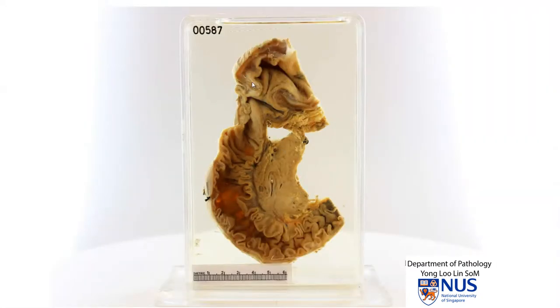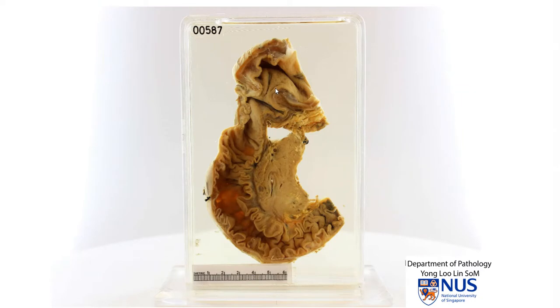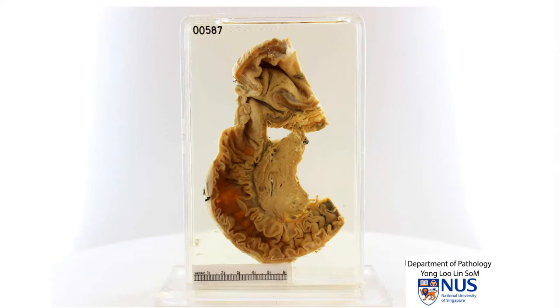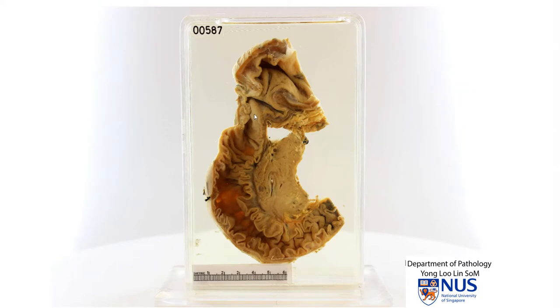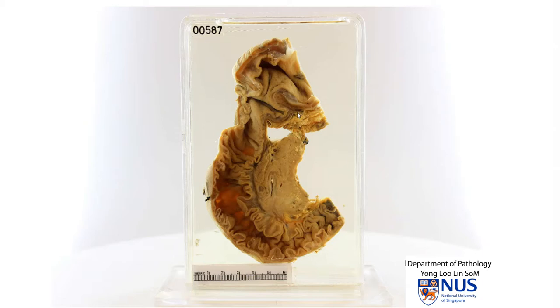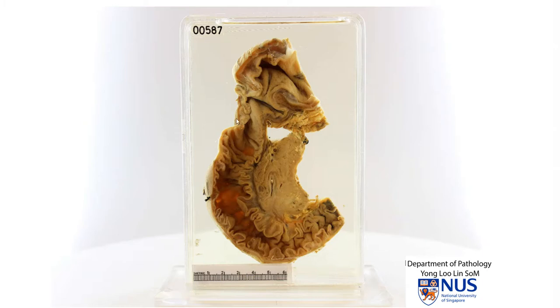Sometimes Whipple's resection specimens also have the gallbladder, but in this instance, the gallbladder is not seen in this specimen.